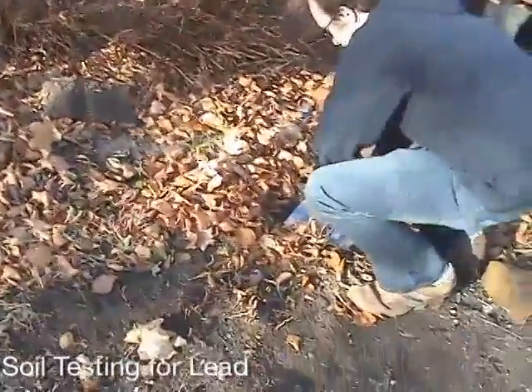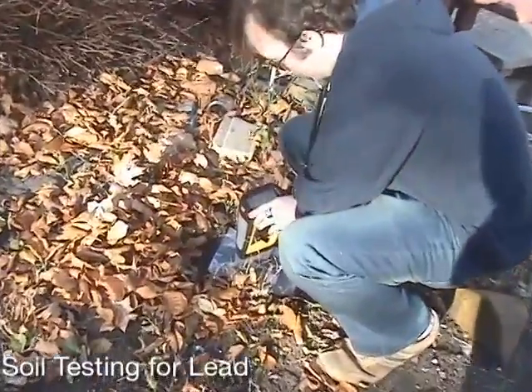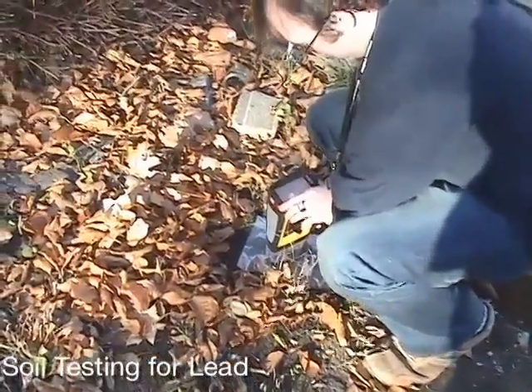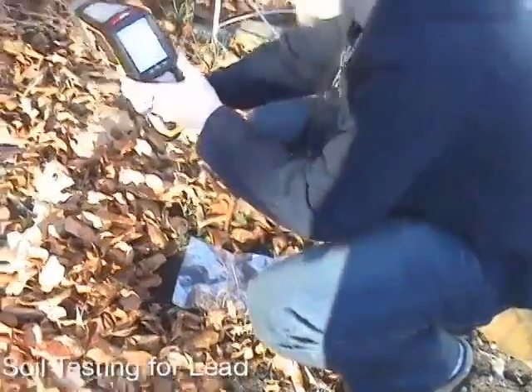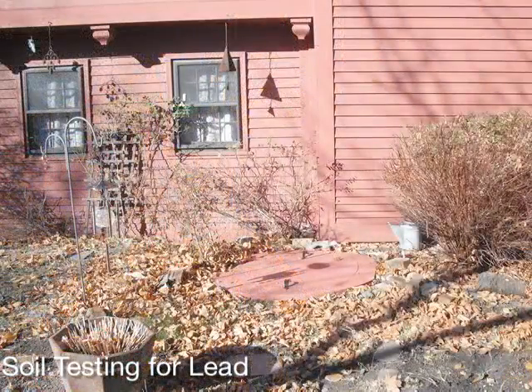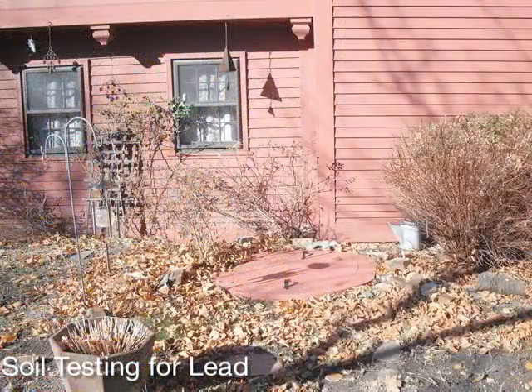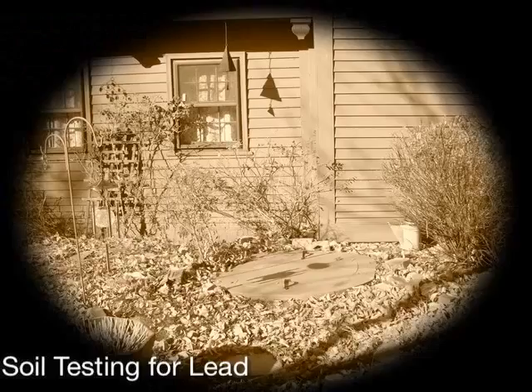The leaves and pebbles need to be cleared to get a good measurement of the soil, and a plastic baggie should again be used between the analyzer window and the soil to prevent sample-to-sample transfer. The readings of the soil are about 1,000 parts per million lead. The 400 parts per million lead US EPA reference level would indicate that this is not a good place to plant edibles or an herb garden, even though it may look historically correct.